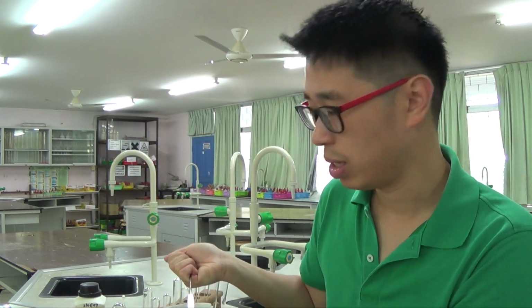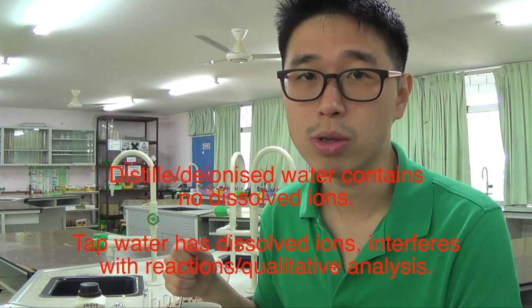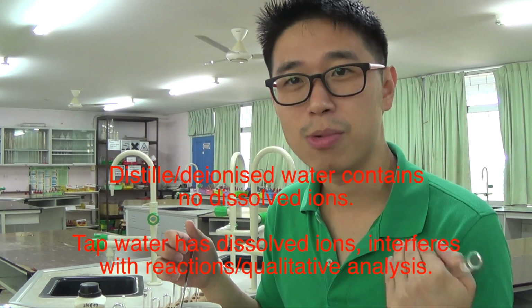The reason for using distilled water instead of tap water is because distilled or deionized water has no other dissolved ions. You are testing for cations and anions. Tap water will have other dissolved ions that can interfere and result in an inaccurate qualitative analysis, whereas distilled or deionized water is just pure water that has been distilled, with no other dissolved ions.